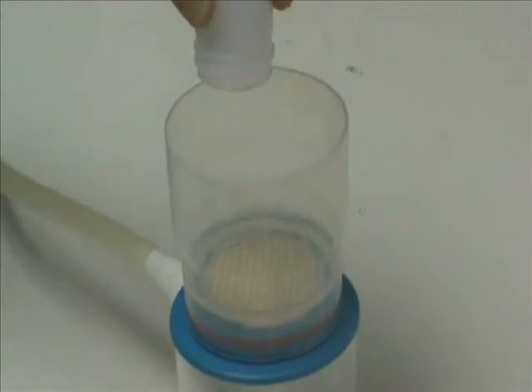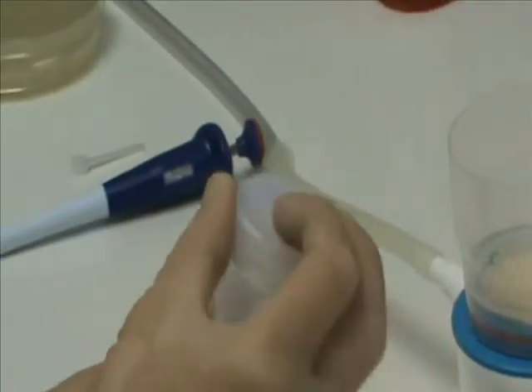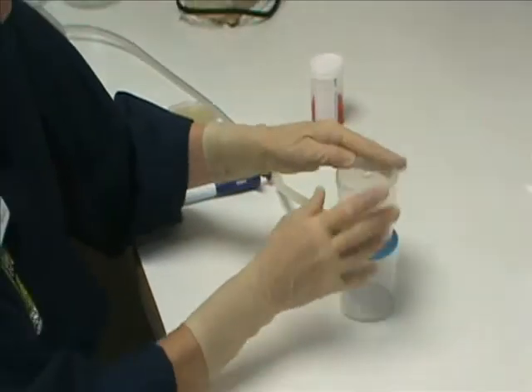The fluid is dumped into the filter. This container is rinsed several times with the saline solution and the rinsate is added to the filter.